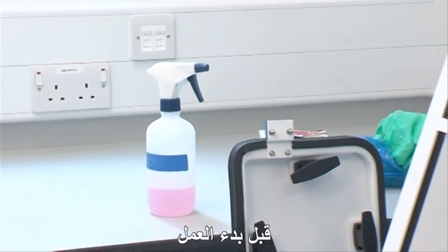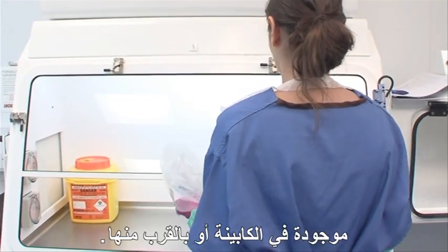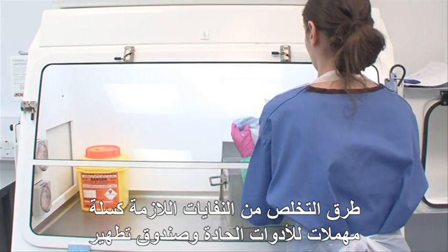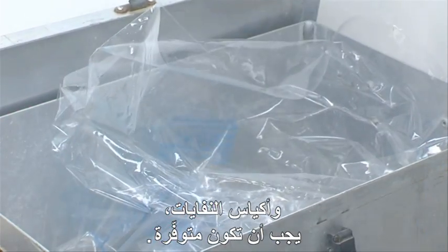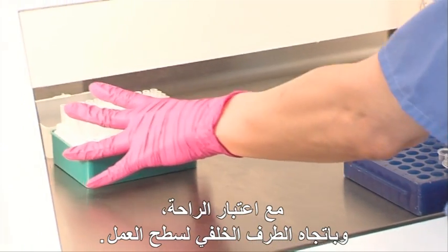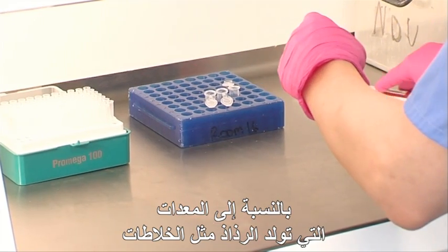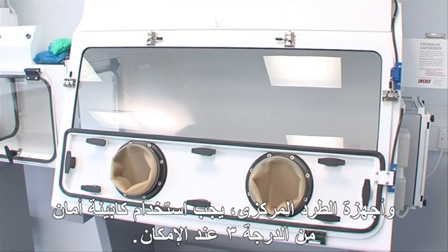Prior to commencing work, laboratory staff must ensure that in-date decontamination materials are available in or near the cabinet. Disposal methods required, such as a sharps bin, decontamination tank and waste bag, must also be available. All materials should be placed as far back in the cabinet as practically comfortable, towards the rear edge of the work surface. For equipment that is aerosol generating, such as mixers and centrifuges, a class 3 cabinet should be used where possible.